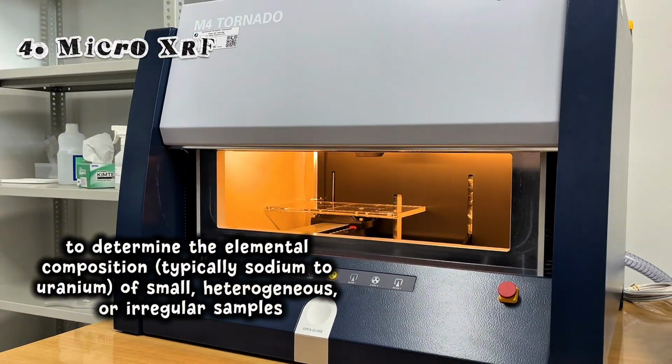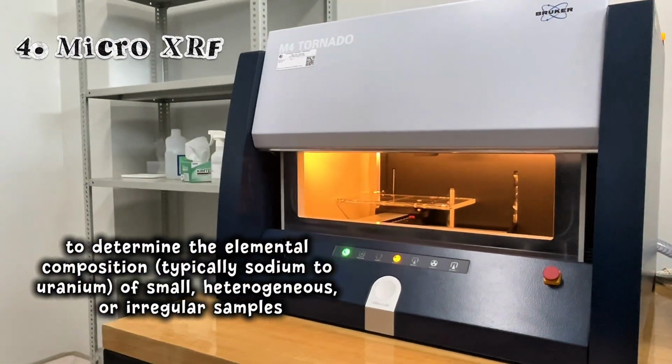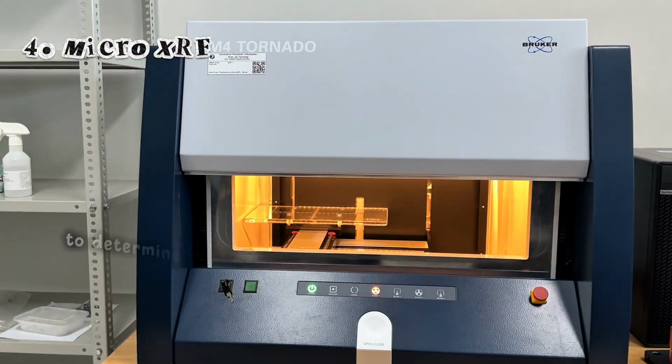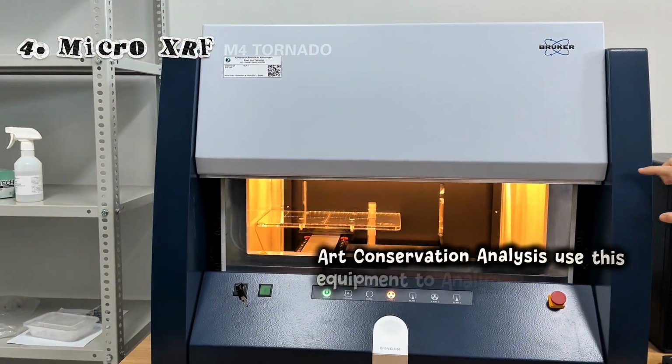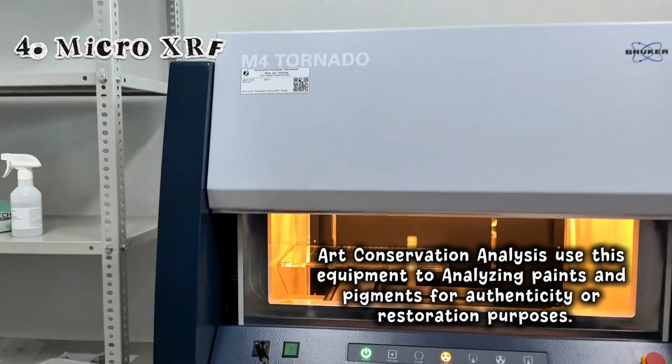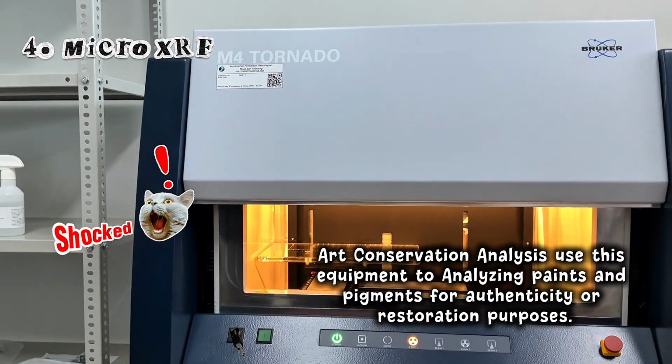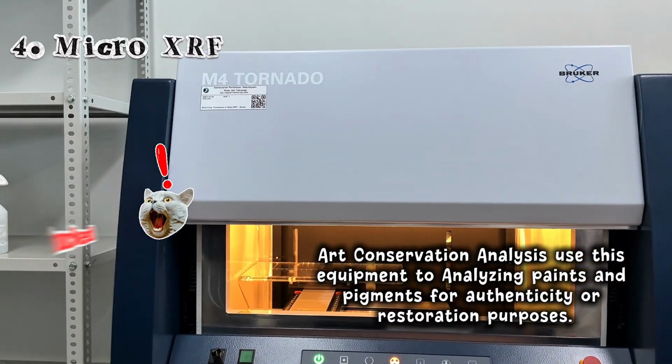It is used to determine the elemental composition, typically sodium to uranium, of small heterogeneous or irregular samples. And do you know, art conservation analysis uses this equipment to analyze paints and pigments for authenticity or restoration purposes.